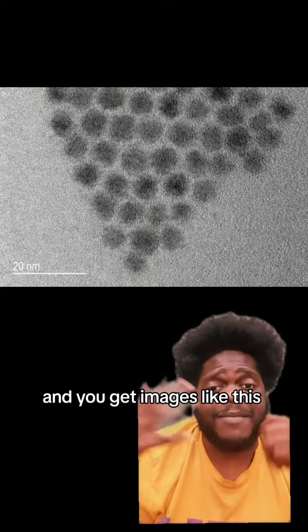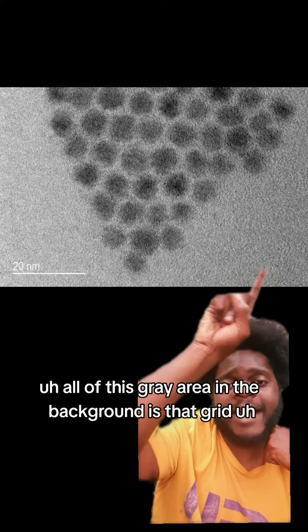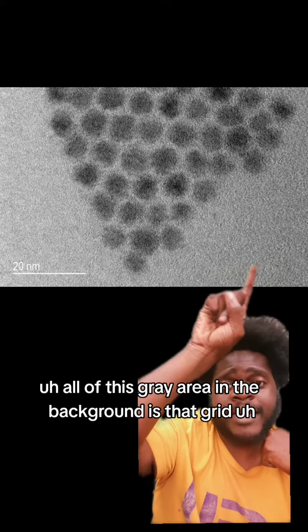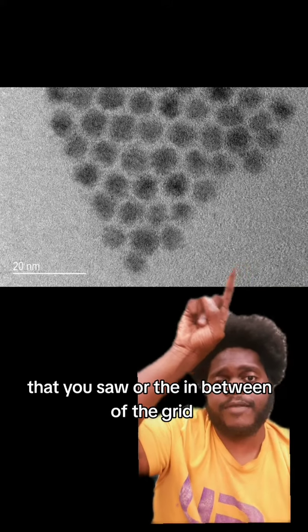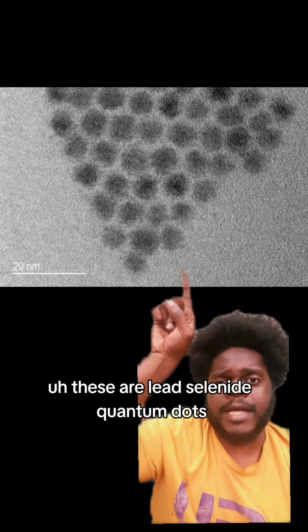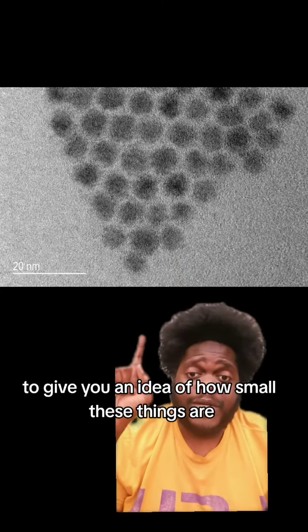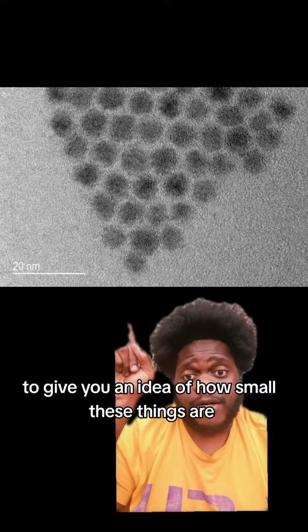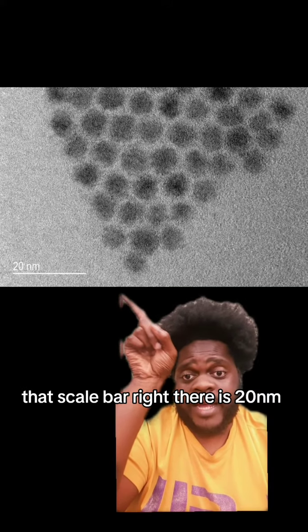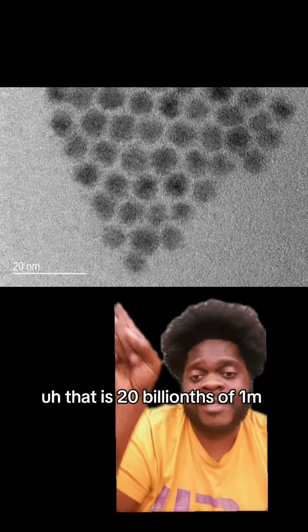And you get images like this. All of this gray area in the background is that grid that you saw, or the in-between of the grid. And these little dark dots are my sample. These are lead selenide quantum dots. To give you an idea of how small these things are, that scale bar right there is 20 nanometers. That is 20 billionths of a meter.